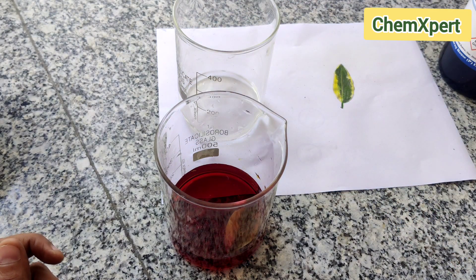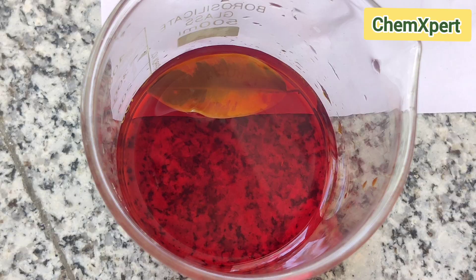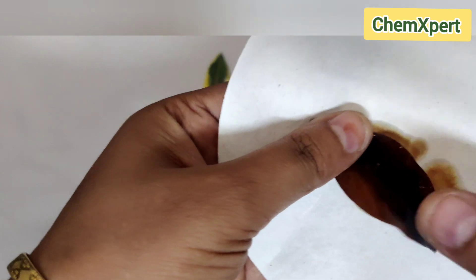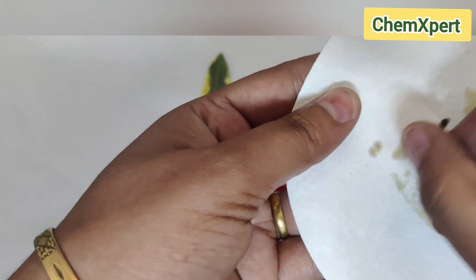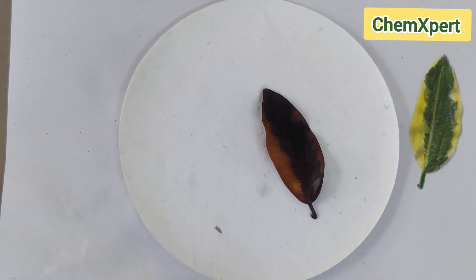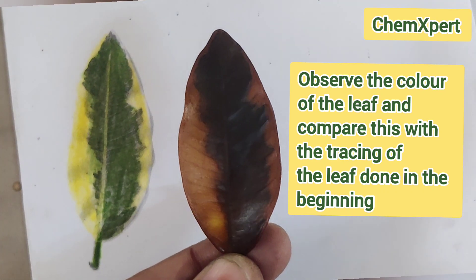After a few minutes, we take out the leaf and rinse off all the iodine solution. To remove iodine stuck to the surface, we place the leaf on filter paper and dip it in water so all surface iodine is removed. Now compare the leaf color with the tracing done at the beginning.